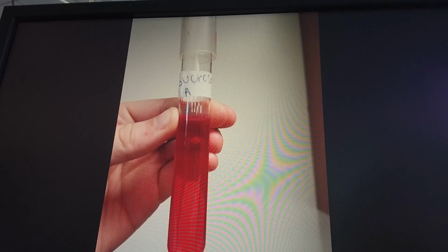A sucrose phenol red test is similar to the lactose phenol red test, but the medium is sucrose and tests for the fermentation of sucrose. Just like the lactose phenol red test, a positive result will turn from red to yellow, and if a gas was produced, there will be a bubble within the tube. We found that our unknown did not ferment sucrose and no bubble was formed.